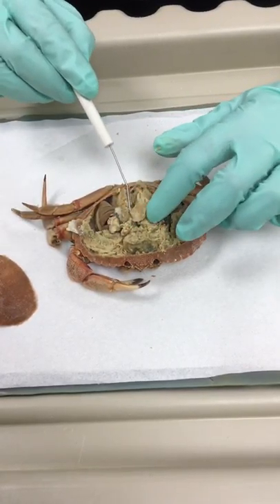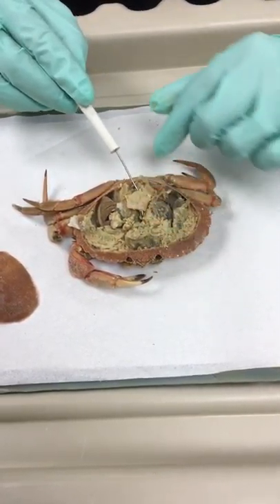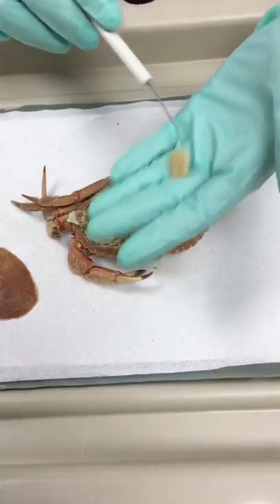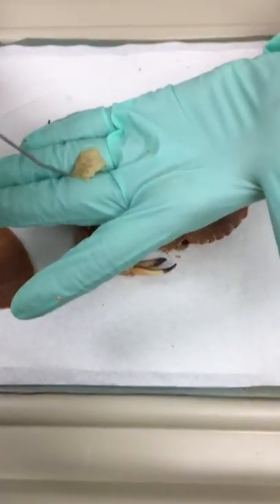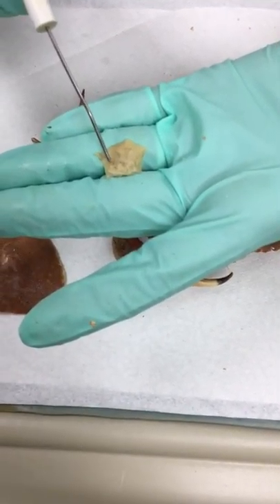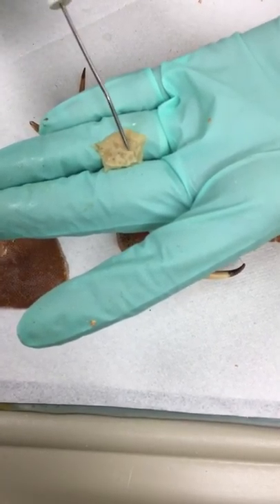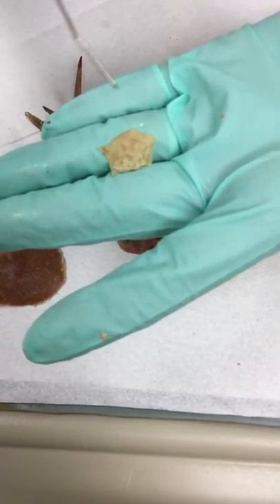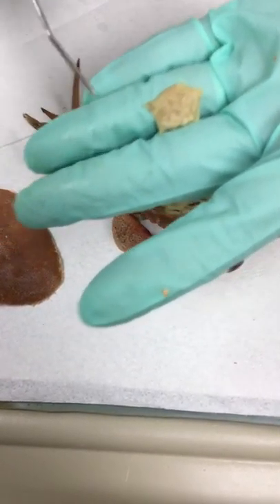It's a super simple heart, and it has some ostia on it. It might be a little hard to see, but there are some tiny little ostia. The ostia are the holes that are in the heart that allow for the fluid to move around.